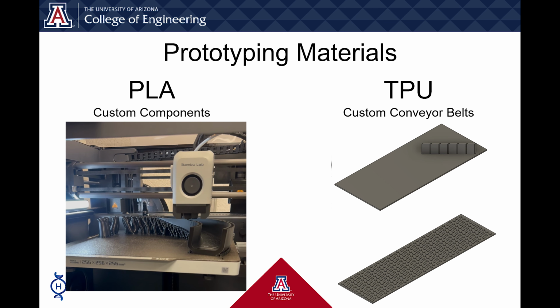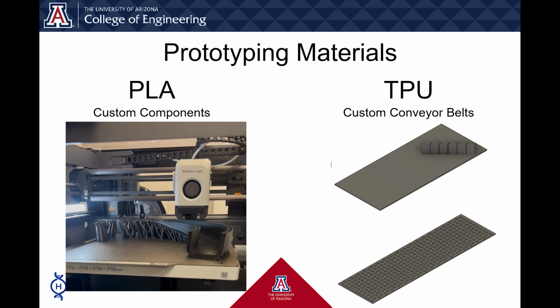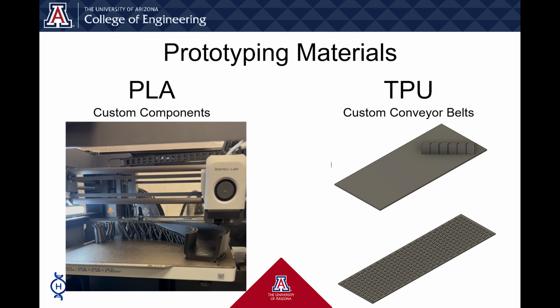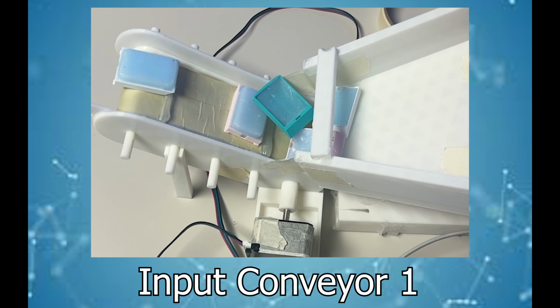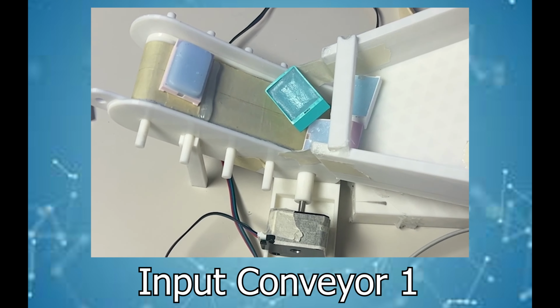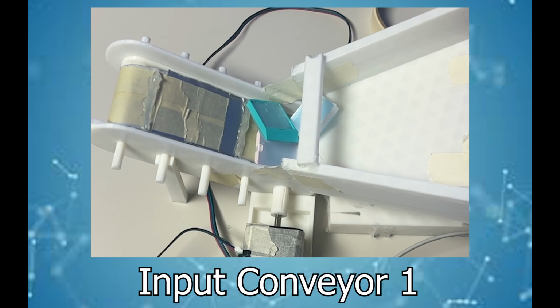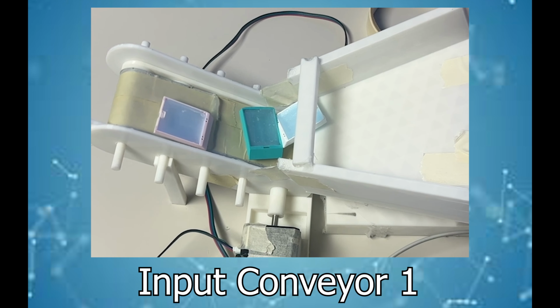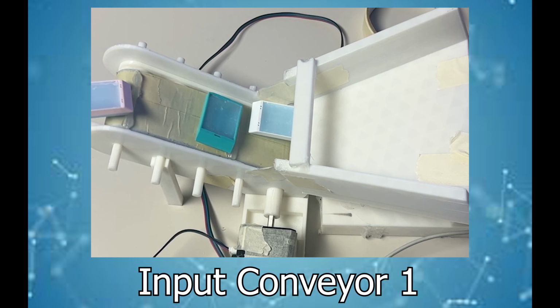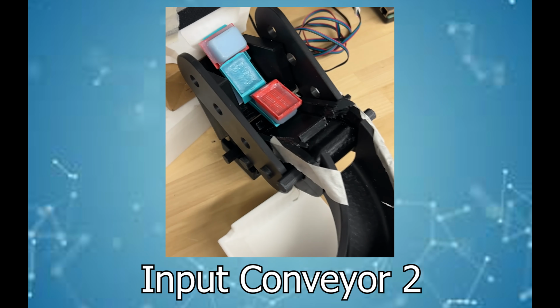We then started 3D printing our parts and continued to test and modify as needed. Some modifications include adding stipples and cleats to increase the friction between the belt and the blocks. Our preliminary input conveyor belt was a general conveyor belt with cleats at a low inclined angle with a general chute. We tested how our input system can handle a batch of tissue blocks and separate them one by one. We found that decreasing the overall width, adding taller cleats, and guided walls will help each block approach the end of the conveyor belt lengthwise.